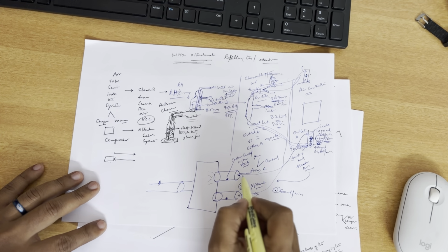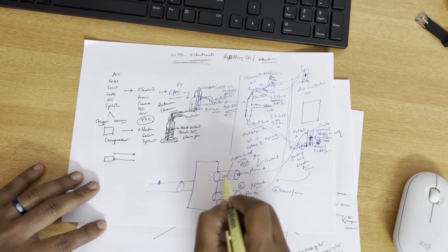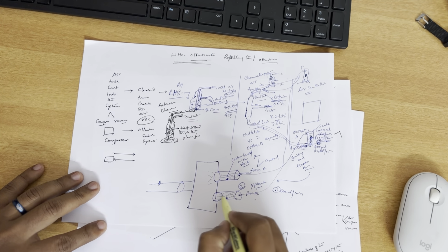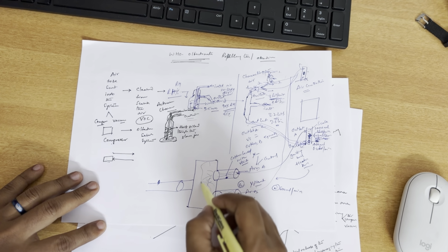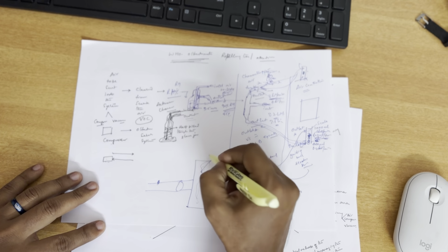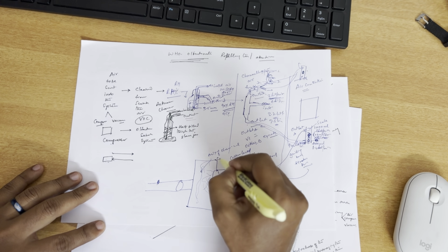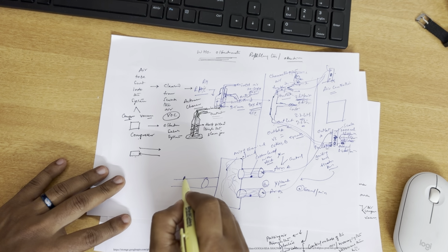The air passing through the volatiles picks up the scent that is placed here, and again equally mixes here. It forms a kind of chemical cloud. Now the insects are released from here.